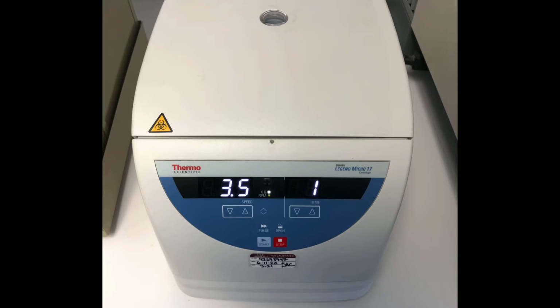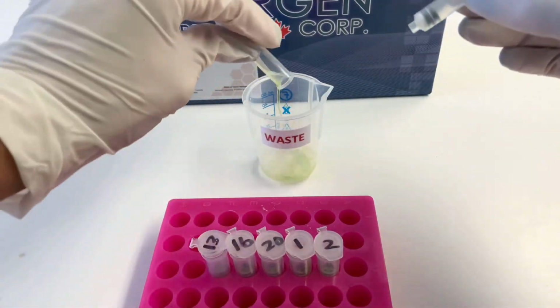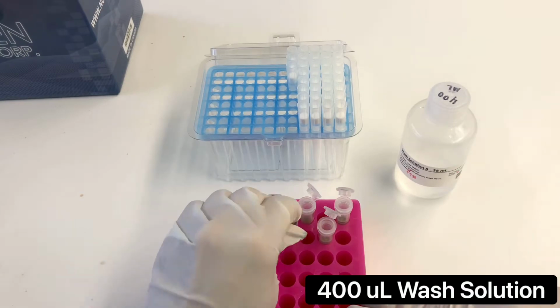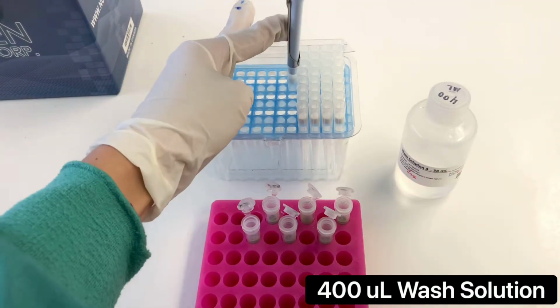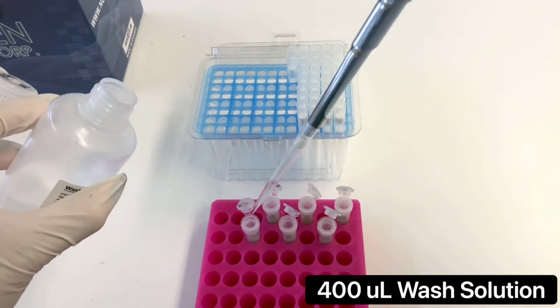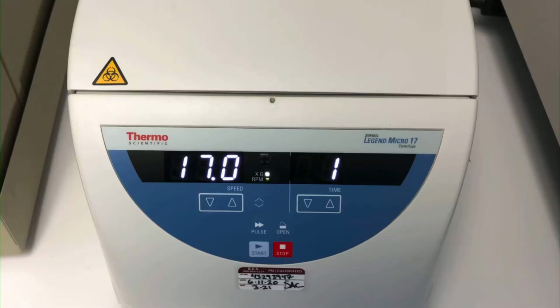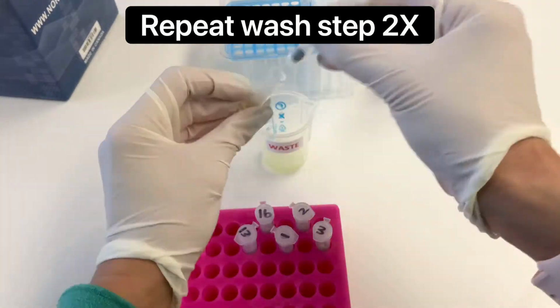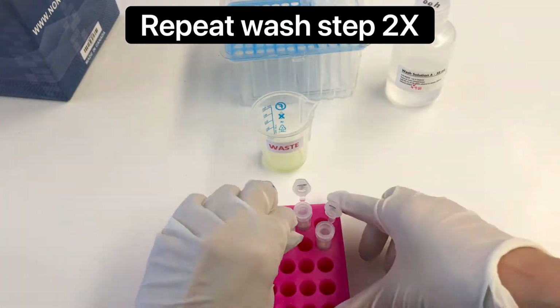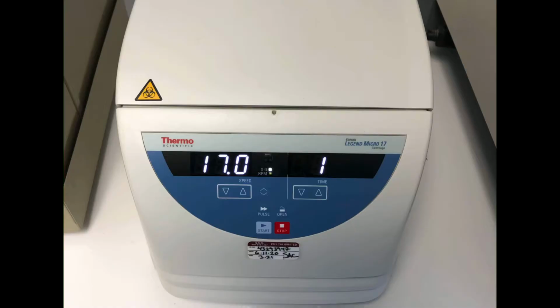Spin the tubes at 3.5 Gs for 1 minute. The RNA is now bound to the spin column and we can discard the flow through. Next, add 400 microliters of the wash solution to the spin columns. Spin the tubes at 17 Gs for 1 minute. Discard the flow through and repeat the washing step 2 more times.